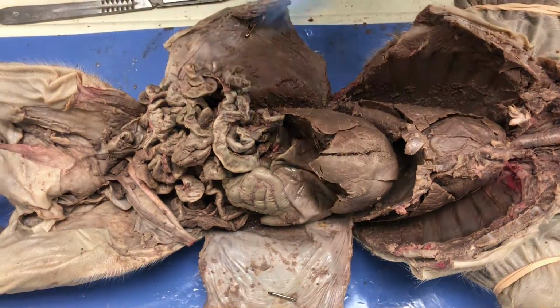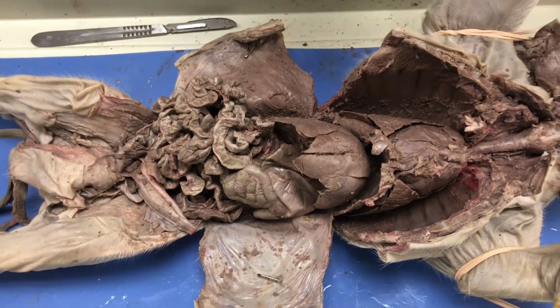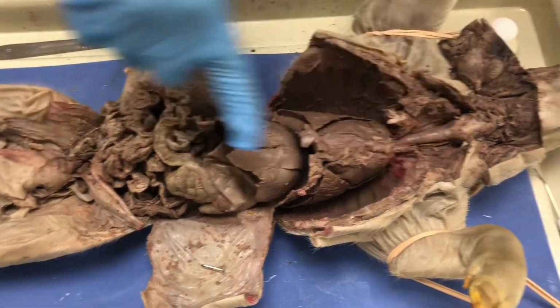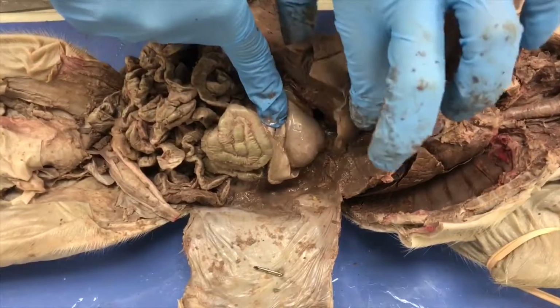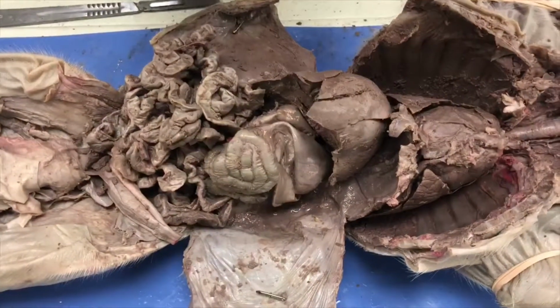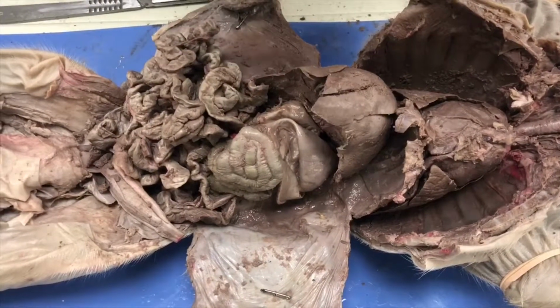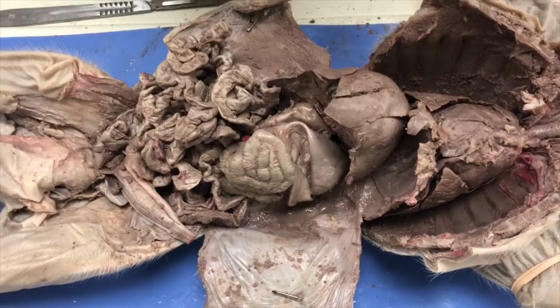Next, the esophagus is the muscular tube that moves food from the pharynx to the stomach. So the pharynx to the stomach down here. The stomach stores food while being mixed with enzymes that continue to break down food. Also secretes strong acids and enzymes to assist breaking down the process.